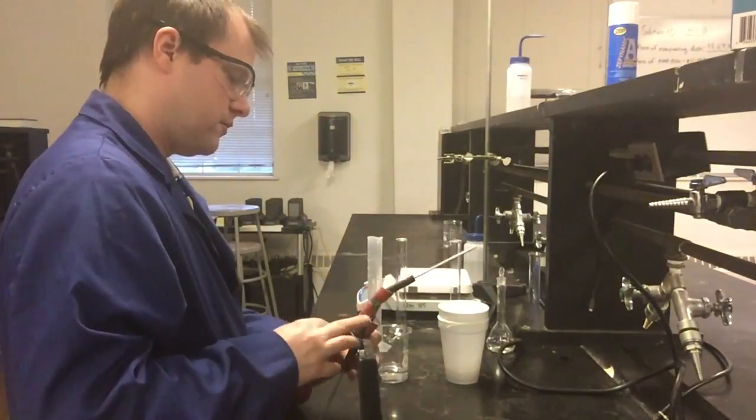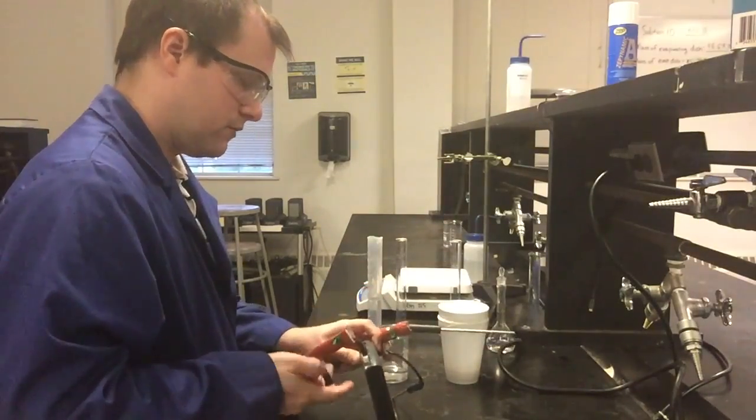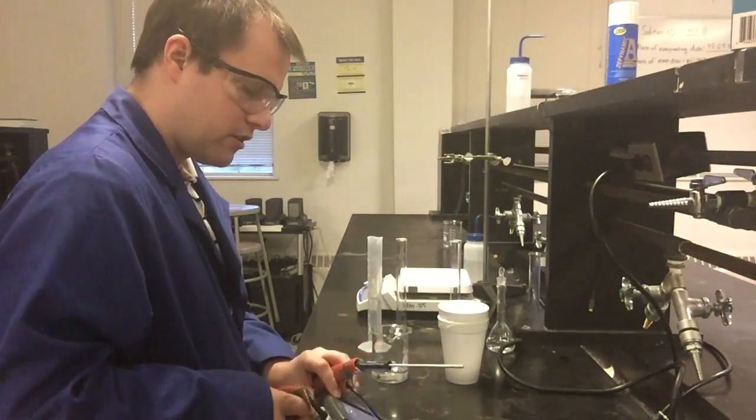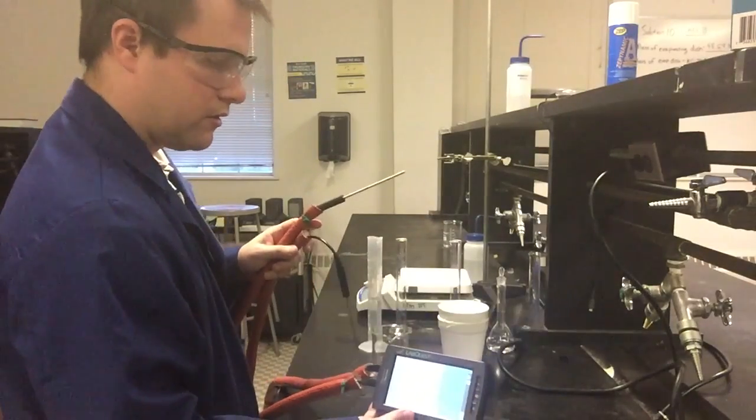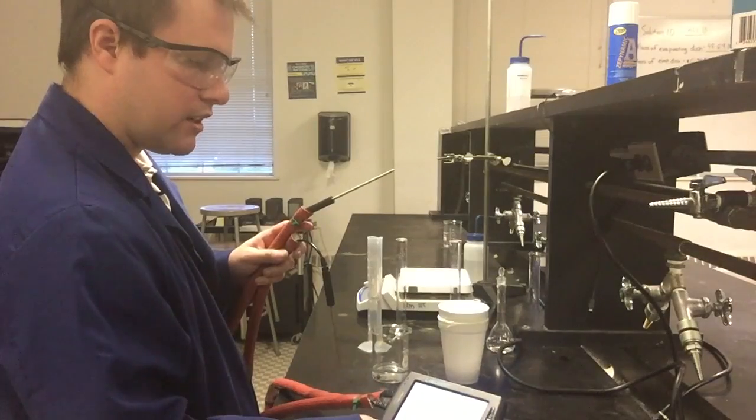Sorry, I have my thermocouples here coming detached. The LabQuest has to kind of update. There we go.